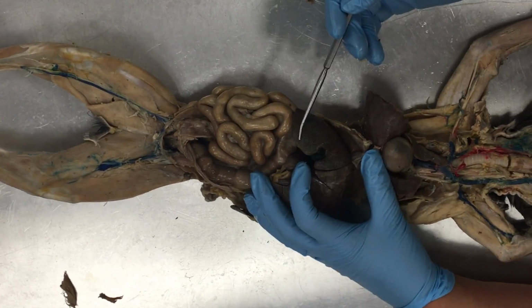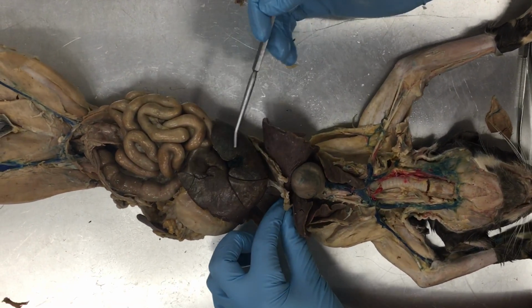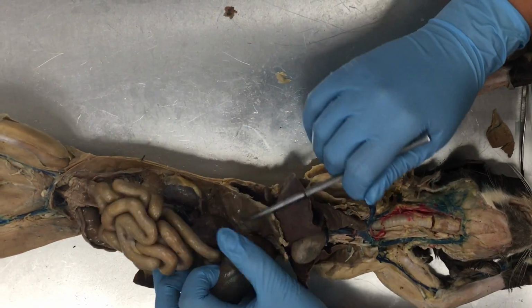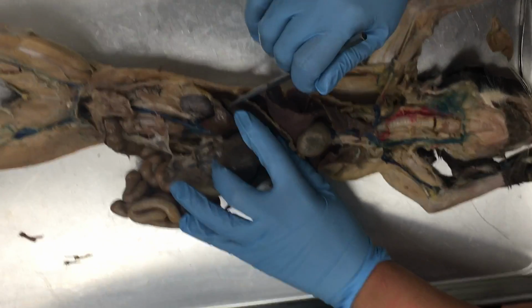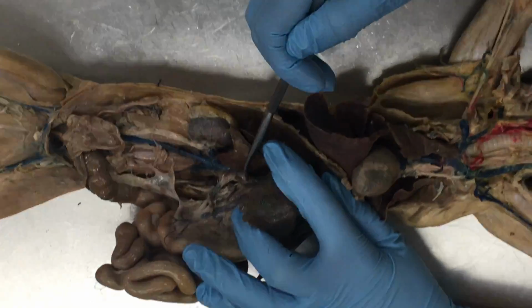Associated with our digestive tract, we have the liver. This is our liver, this big organ right below the diaphragm, this sort of purpley color. The cat liver has 5 lobes. In the very, very back, there's this little lobe right here. This is our caudate lobe. All right, so it's actually right at the back body wall.